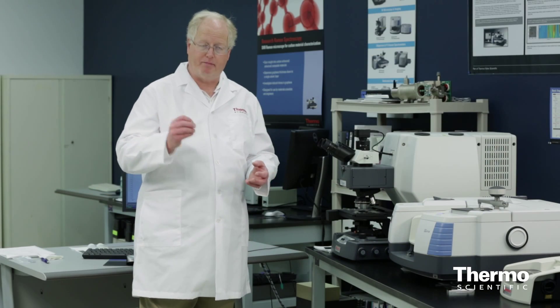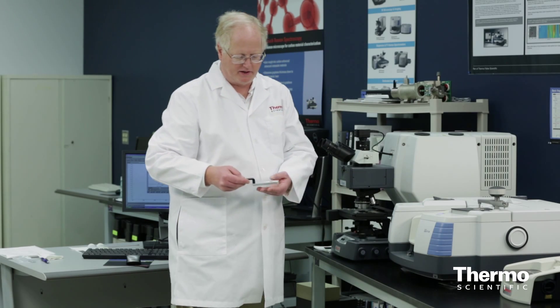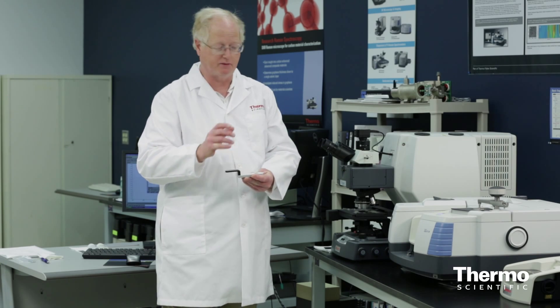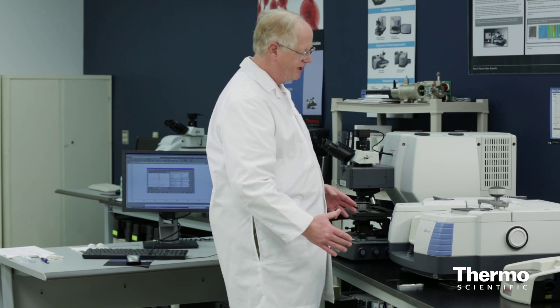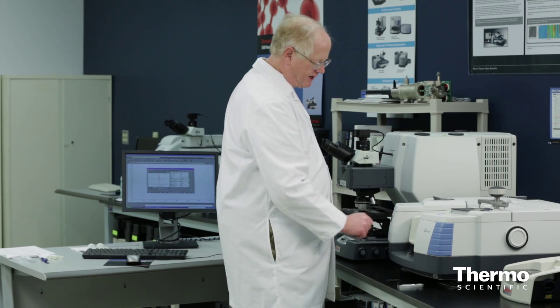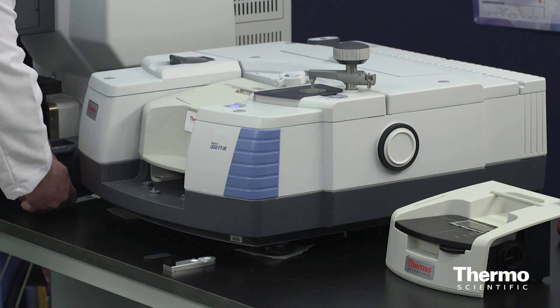Diffuse reflectance uses a powder sample placed into this accessory. Here is my sampling shuttle, which has in the front the potassium bromide, and in the back the potassium bromide with a small amount of my sample in it. The accessory has been inserted into the Thermo Scientific Nicolet IS-50 FTIR — it's a smart accessory for diffuse reflectance. Sitting in it right now is a gold mirror for reference, used to line the instrument up.